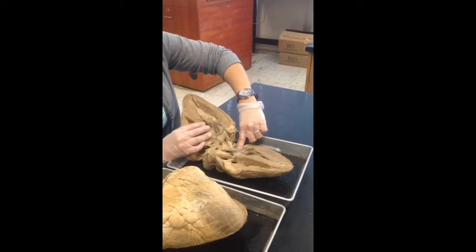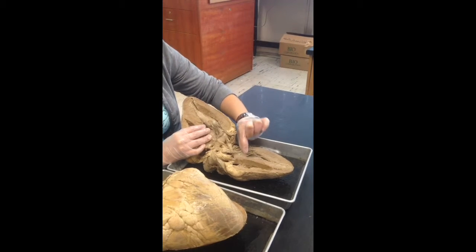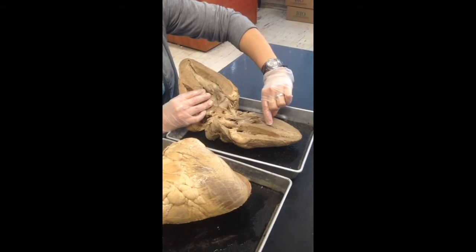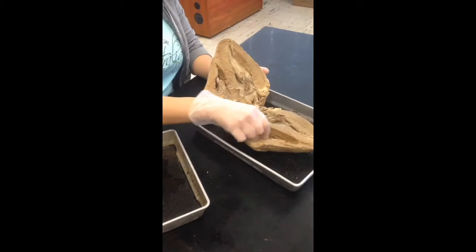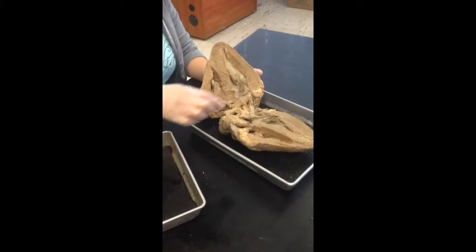This is the left atrium. Below the valve there is the left ventricle. The valve on the left side is the mitral or bicuspid valve. Those strings are the chordae tendineae. The muscle it attaches to is the papillary muscle. On the right side, you have the right atrium, the tricuspid valve, chordae tendineae, papillary muscle, and then down here is the right ventricle.